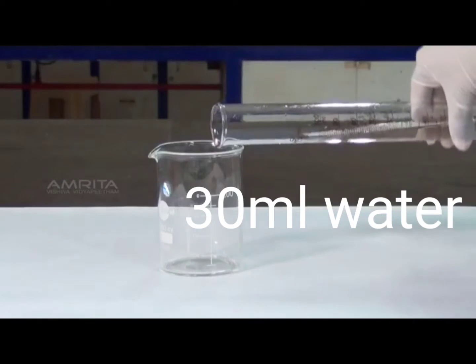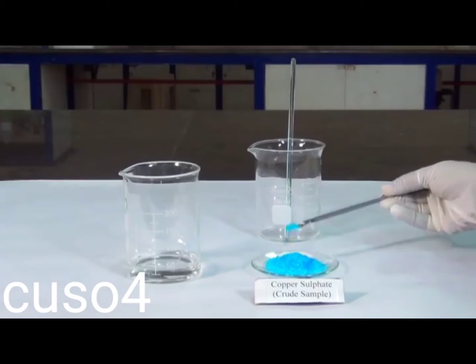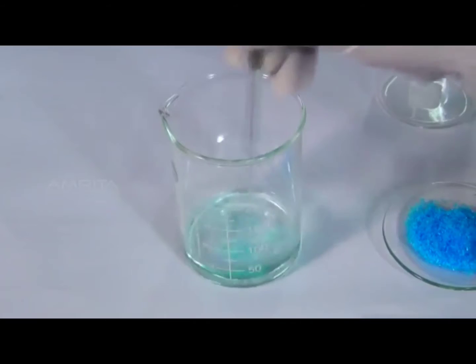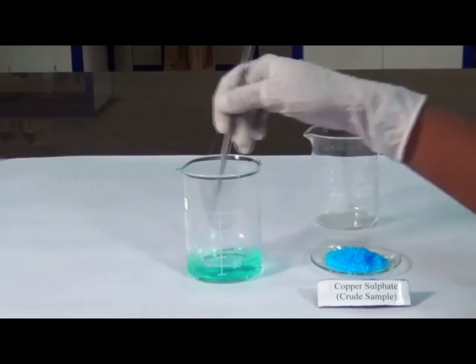Procedure: preparation of solution of the impure sample. Take about 30 ml of distilled water in a beaker. To this, add powdered crude sample of copper sulfate using a spatula. Stir the solution gently with the glass rod so that the powder dissolves.